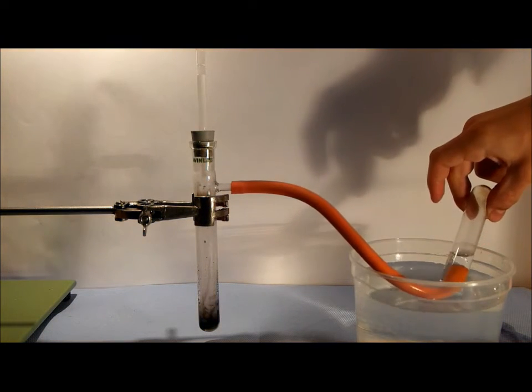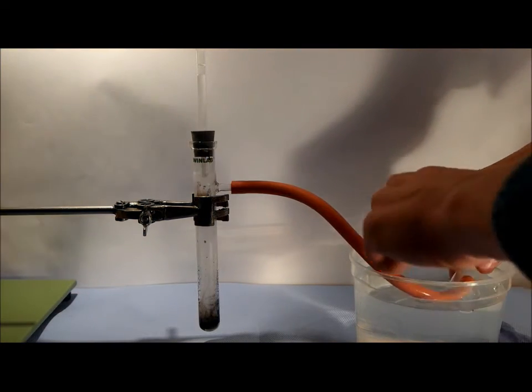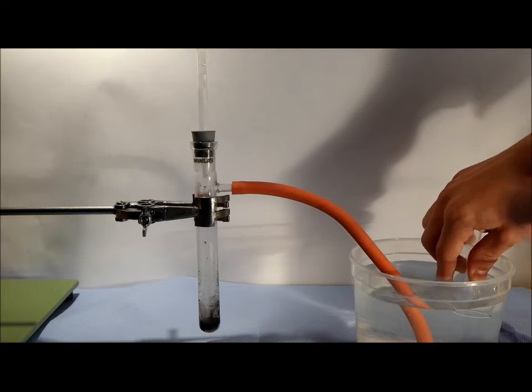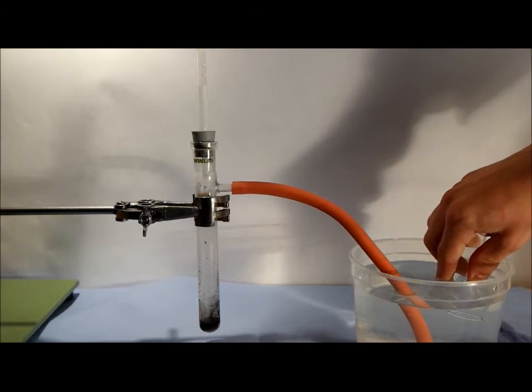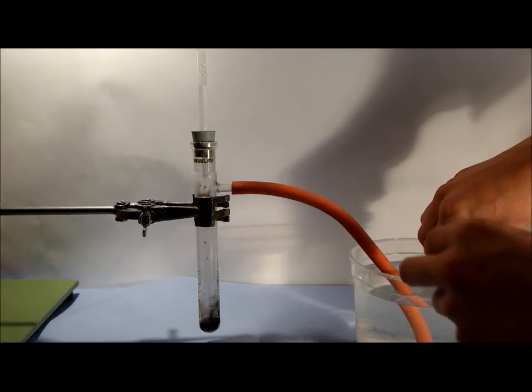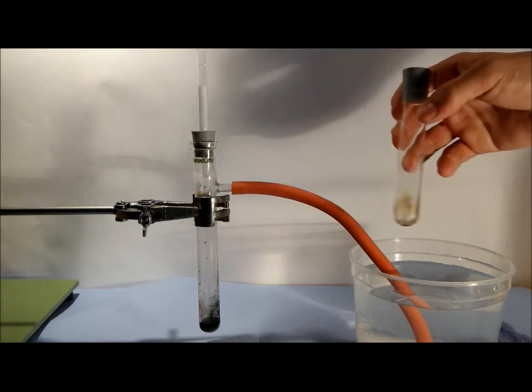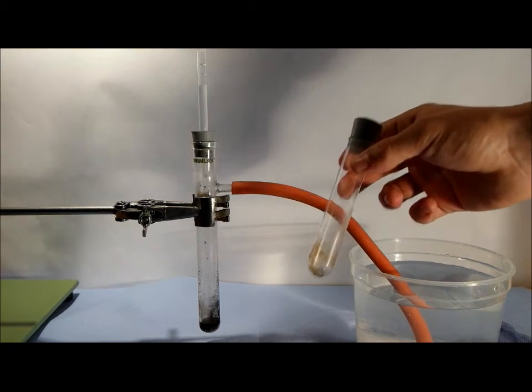So now what you see inside here is pure oxygen. You can close this test tube with another stopper so that you get your pure oxygen in this test tube.